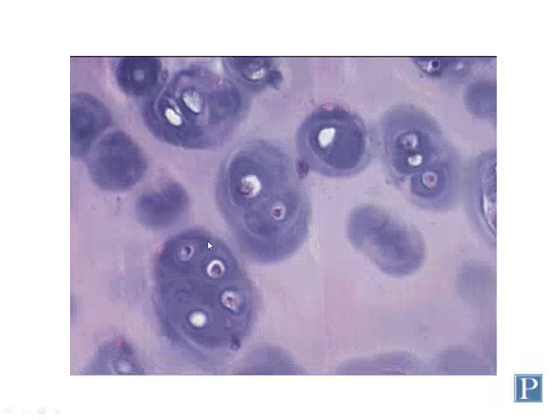In this slide you can see lacunae, large lacunae with multiple chondrocytes within them. This one has at least 5 different chondrocytes you can see here: 1, 2, 3, 4, 5. Here you have 2 or 3. Here's 3. So as I said, some chondrocytes can continue to divide within lacunae through a process known as interstitial growth. Chondrocytes that are clustered together in these lacunae that are genetically identical, these are called isogenous groups or cell nests. So either of those words is interchangeable.